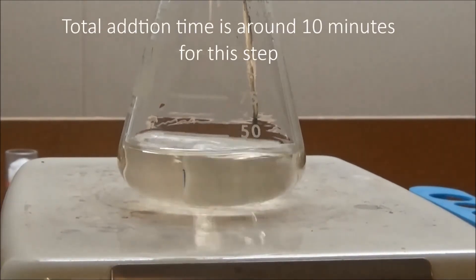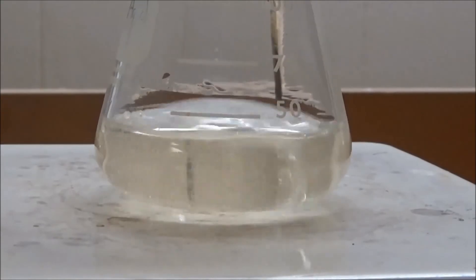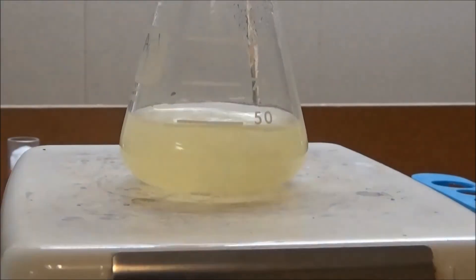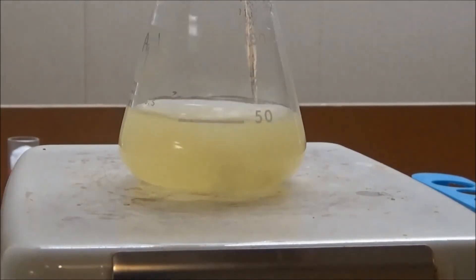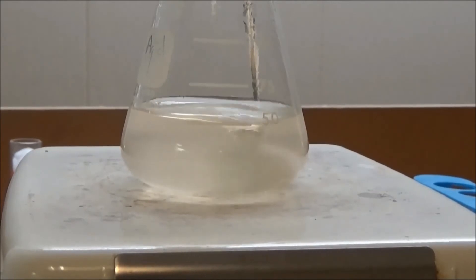I kept it around 60 to 70 Celsius, and you can see bubbles started to be produced. These bubbles are, of course, nitrogen gas. The whole addition took about 10 minutes, and it turned yellow and then eventually became more colorless.